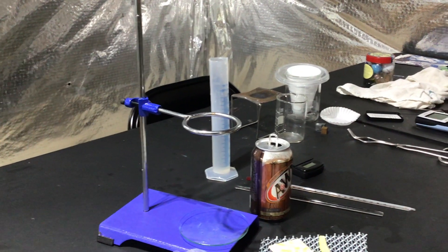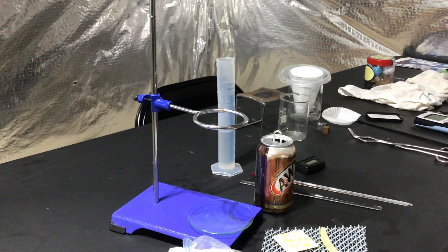I want to show you how to set up the soda can calorimeter and a few instructions.